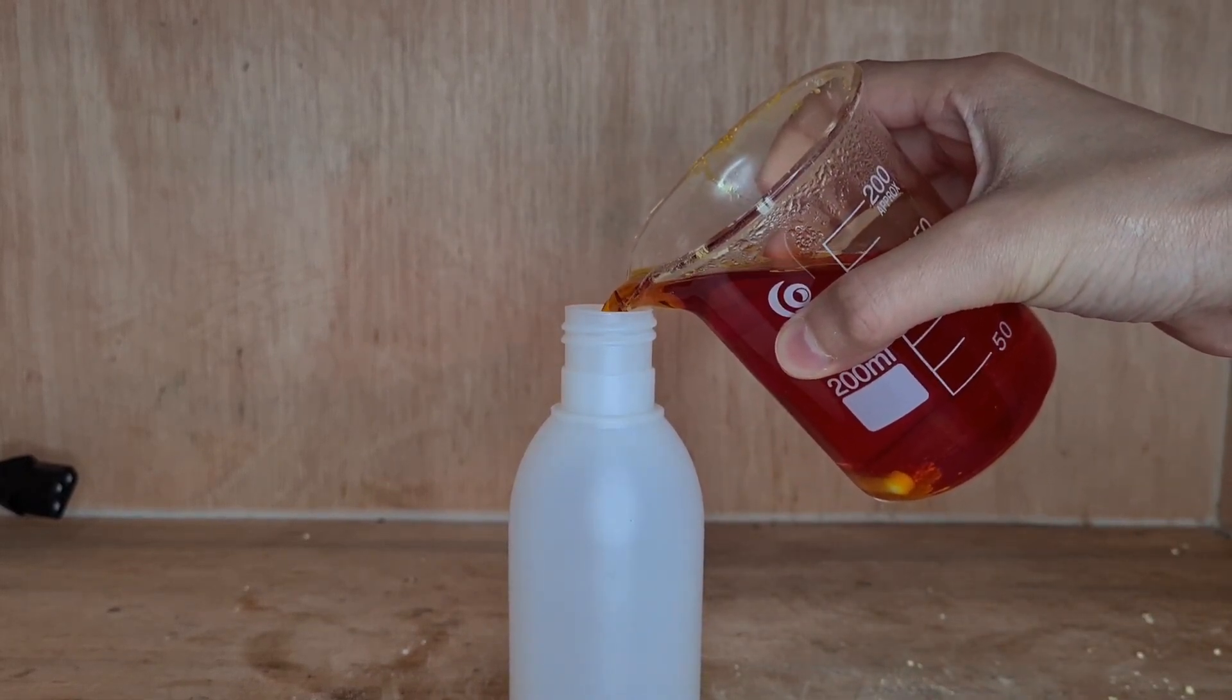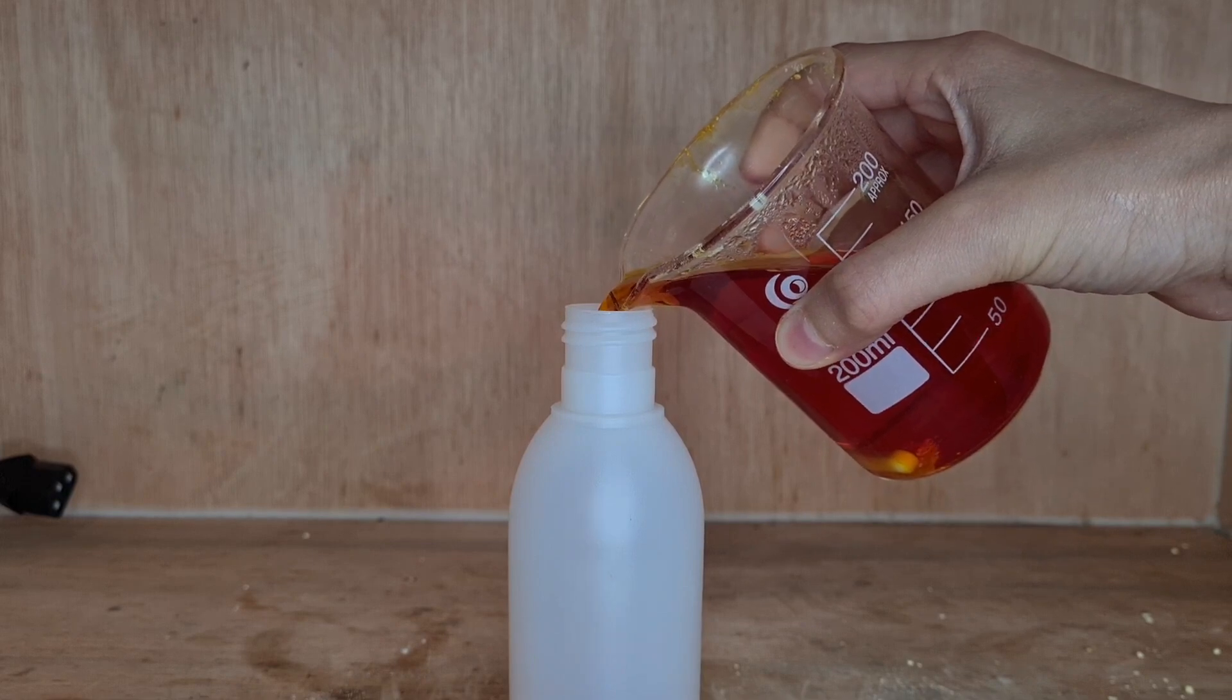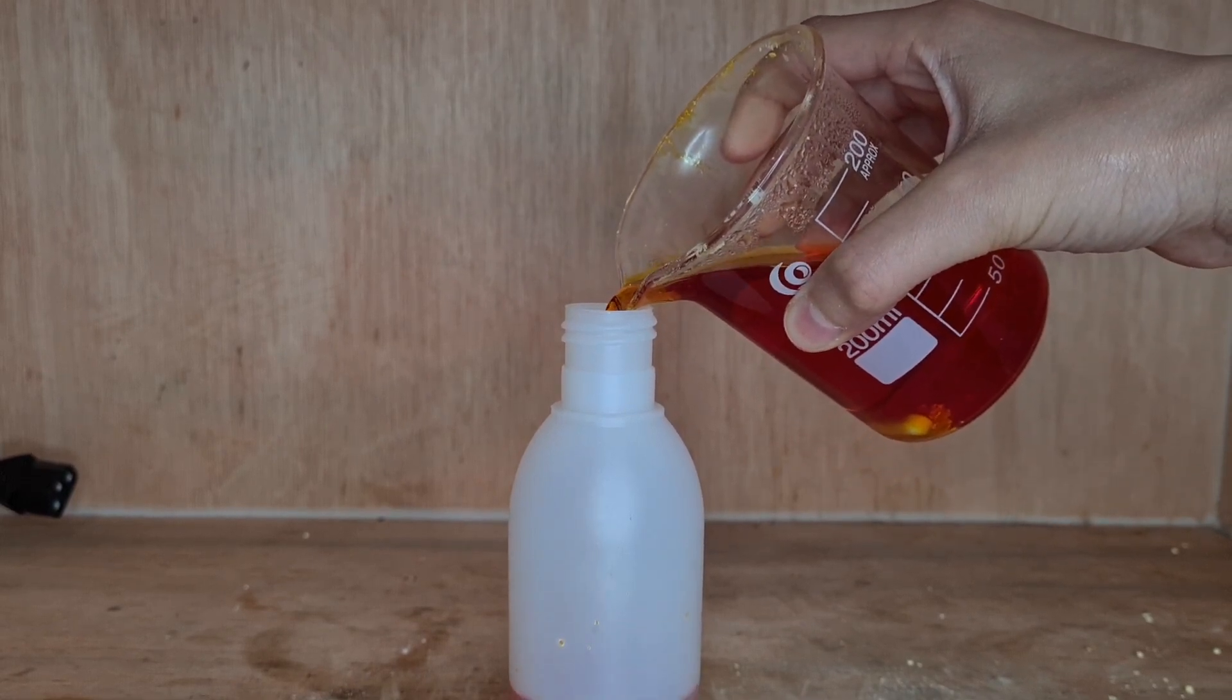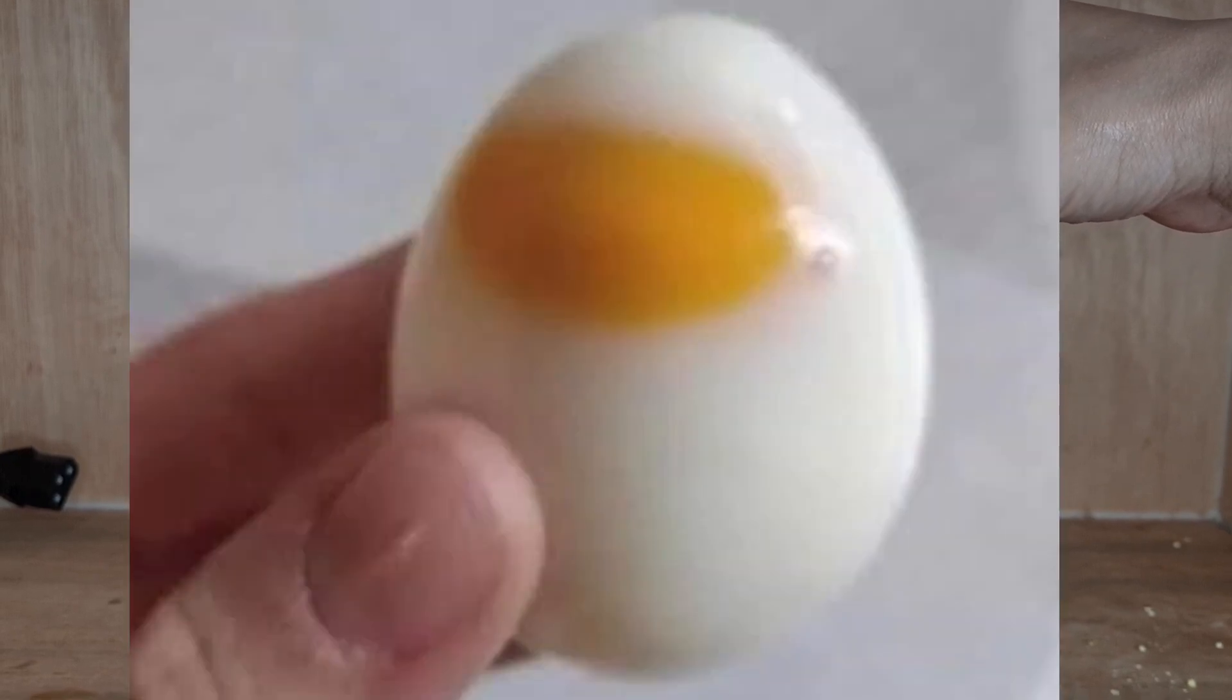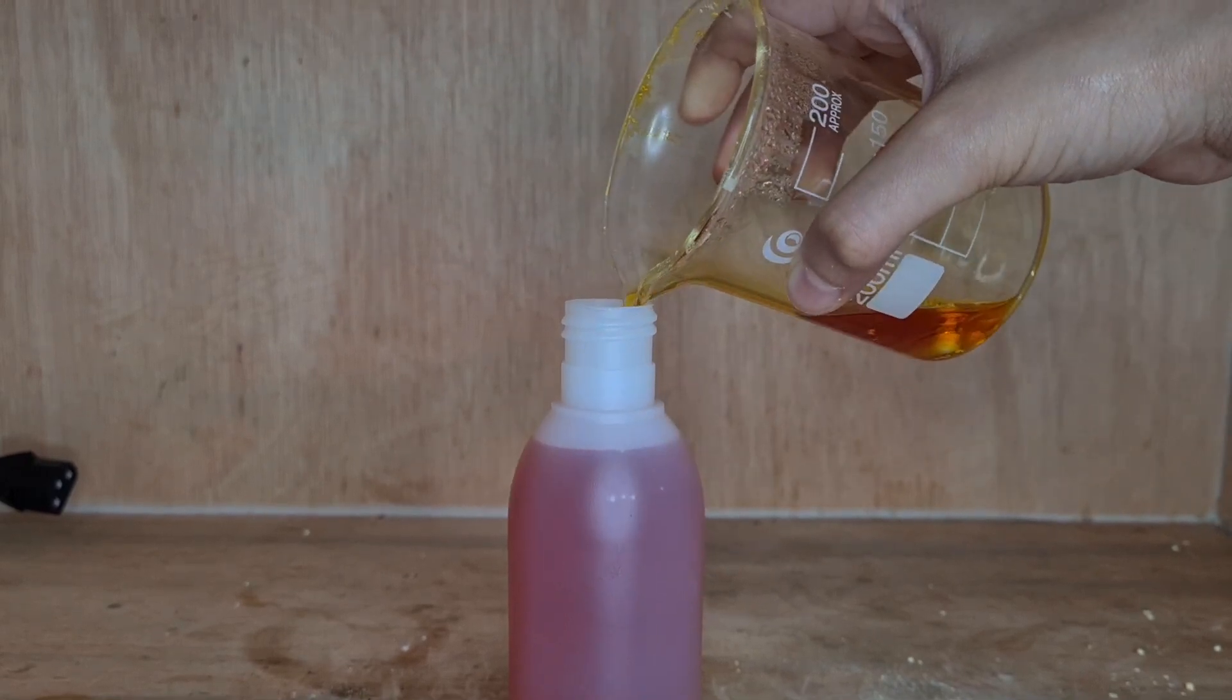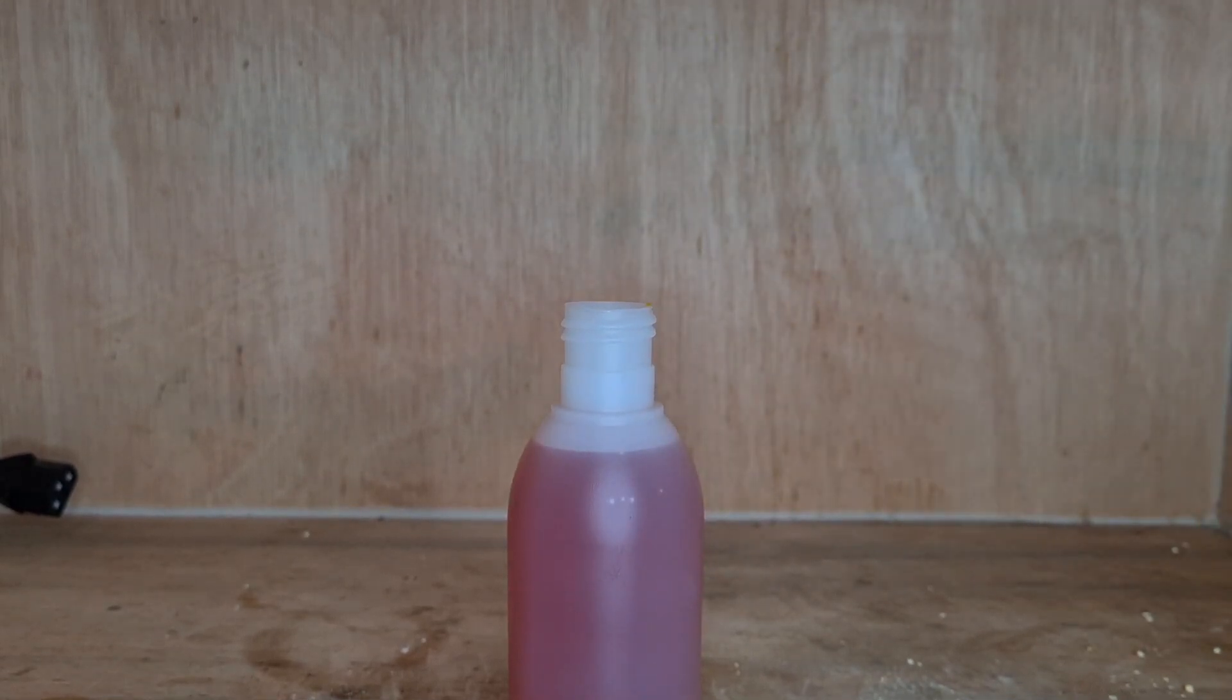For some reason, this part really smelled quite bad and it was probably because of the evolution of hydrogen sulfide gas, aka egg gas. While cooling down, a bit of sulfur precipitated and I made sure not to include that in the solution.